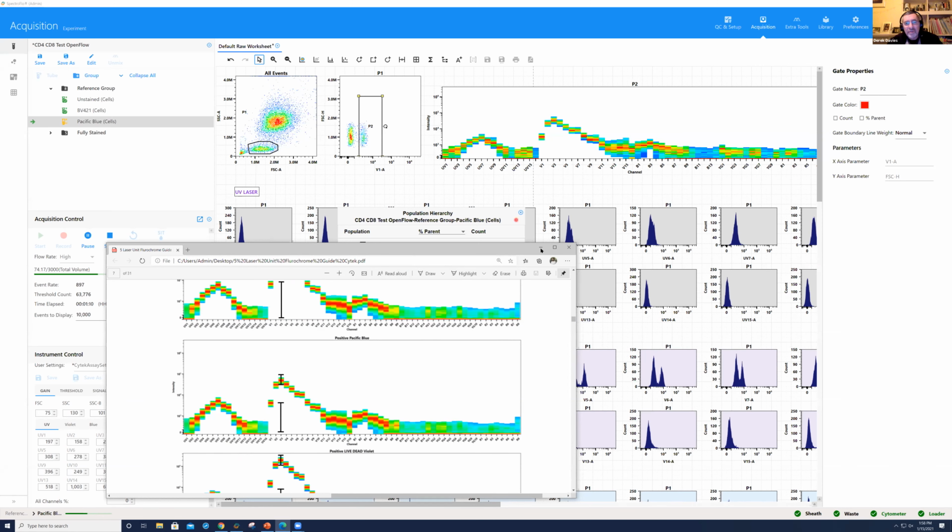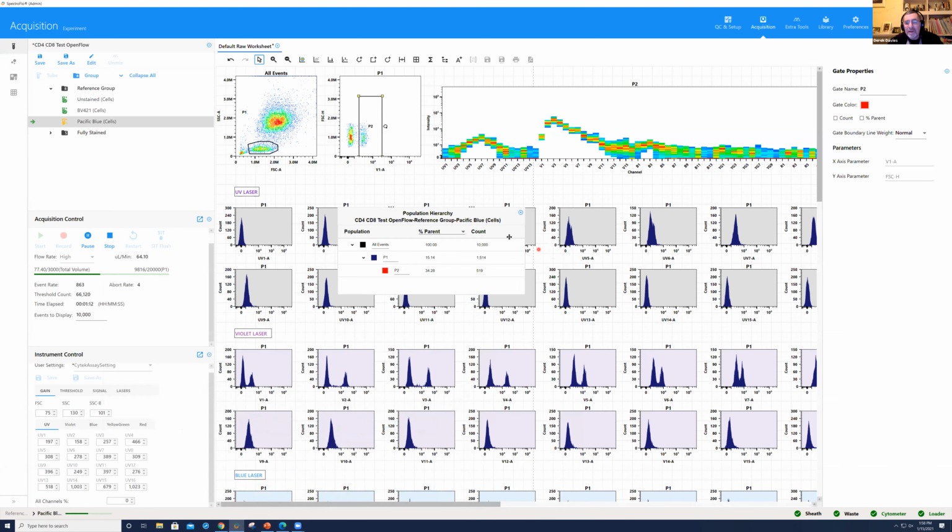So Kathy, sorry, can I interrupt you? There's another question from Cedric here about looking at the full signature. So can you from that tell if the staining is bad? And if you can, how does that manifest itself?